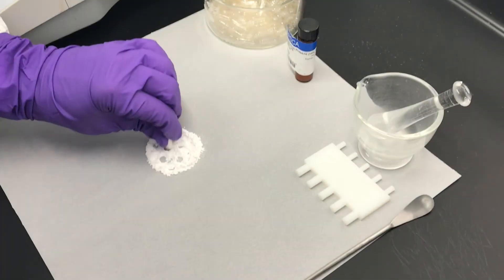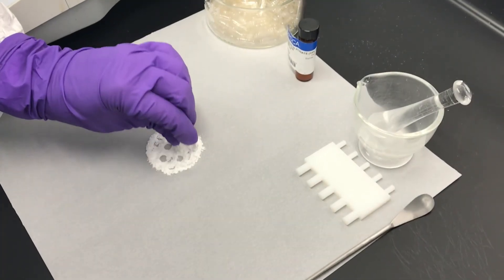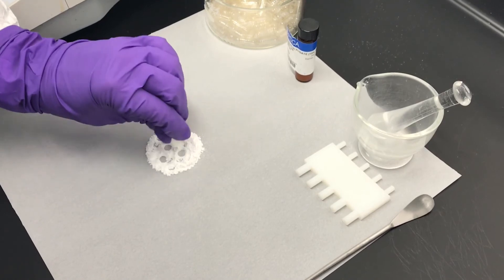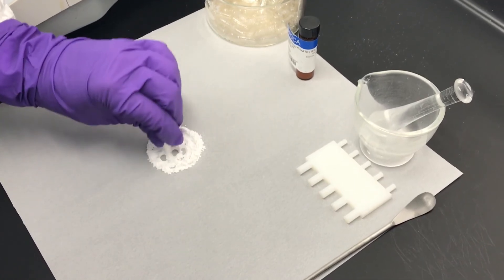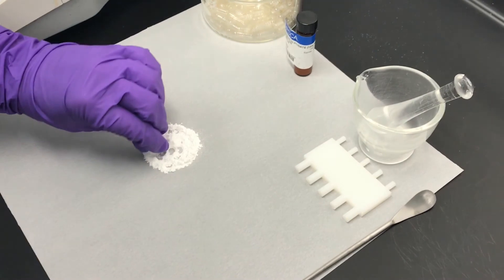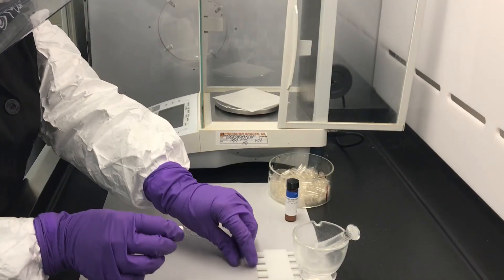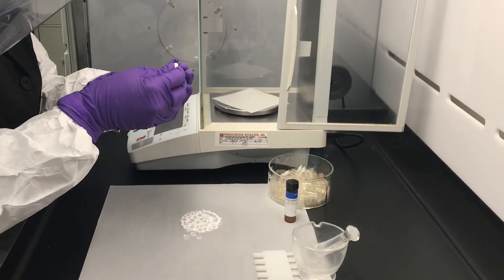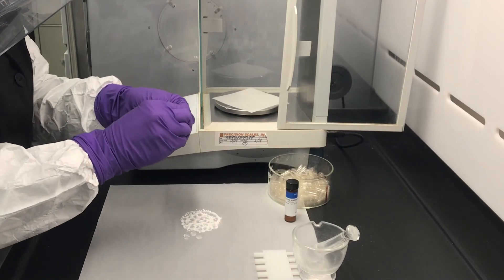You can use a twisting motion towards the end of the process as shown here. Make sure to not overpack to where the capsule is bulging, and don't force the powder super tight. Now that the capsule is filled, replace the top portion of the capsule and place on the balance. Record the weight.